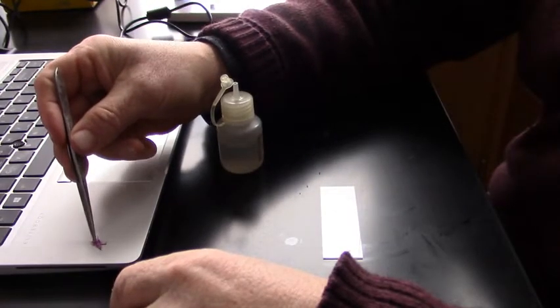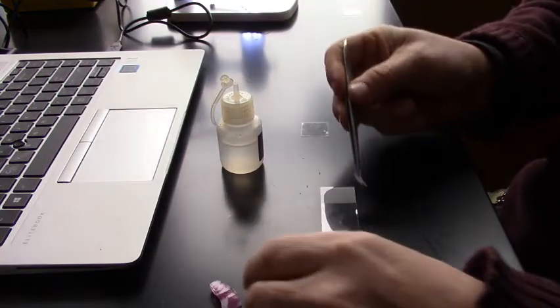The organisms that we're going to be using are that of a red onion. If you get a red onion at the store, you can prepare a wet mount slide by peeling off some of the skin that has a reddish tint to it. And you can make a wet mount slide like you see me doing here.